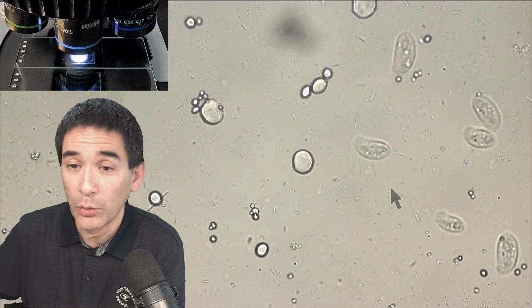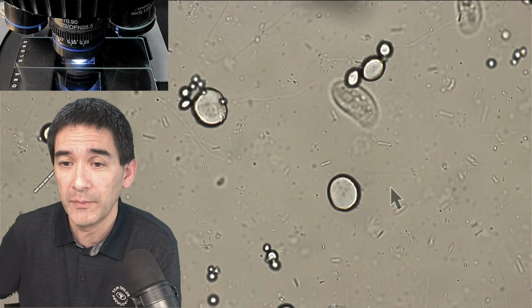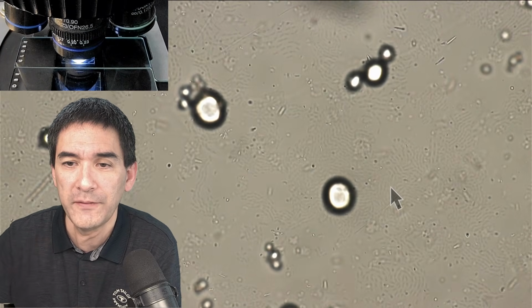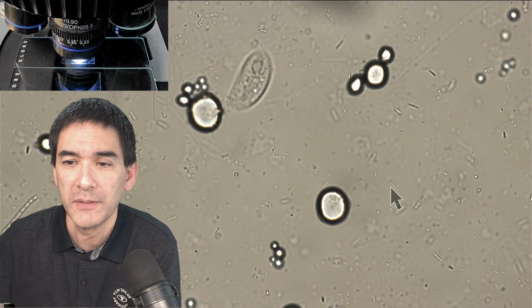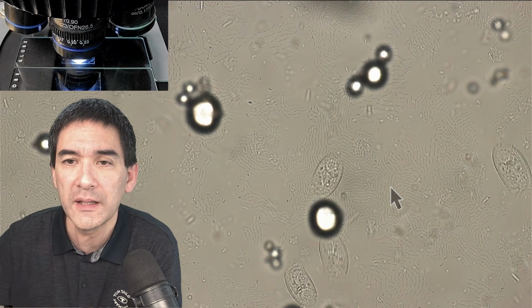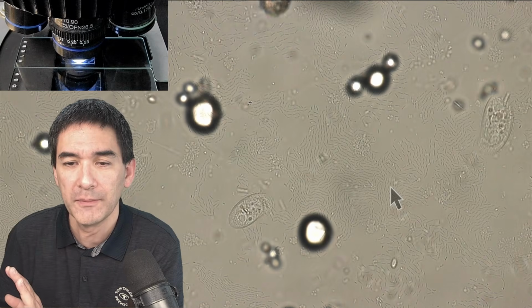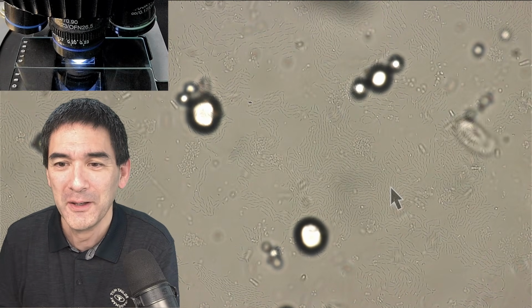What I'm going to do now is go up with the magnification, and every time when I go up with the magnification, we have a problem, and the problem is the lower depth of field, of course, right? And those cells are simply swimming in and out of the field of view. But here, I want to show you something else. Again, I'm now completely in bright field, okay? If you do this same thing, you should also be able to see that.